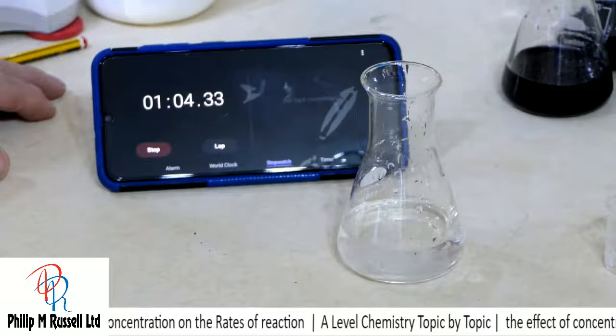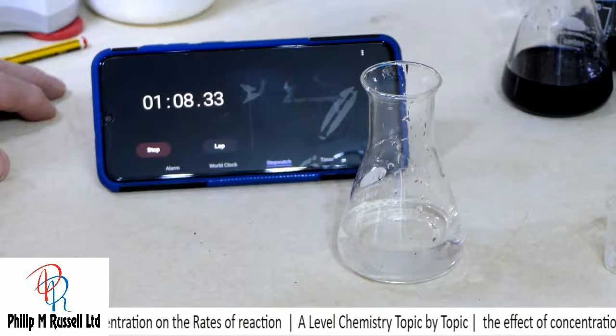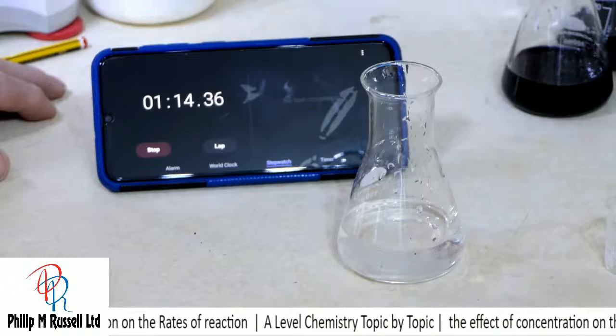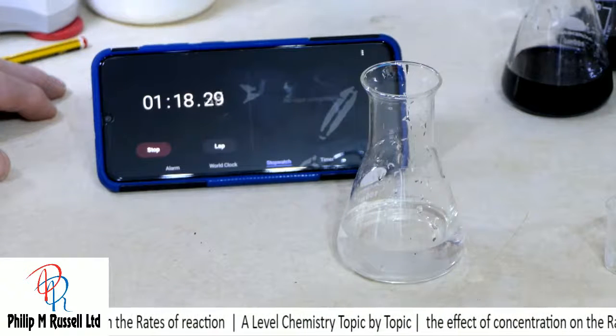Right, can you spot what I didn't do? Because that is certainly taking way too long. Something went wrong there.